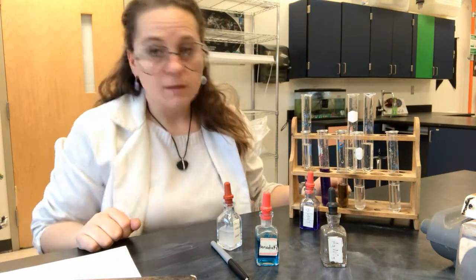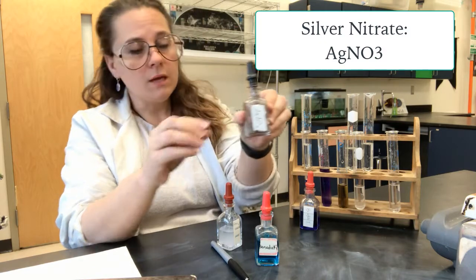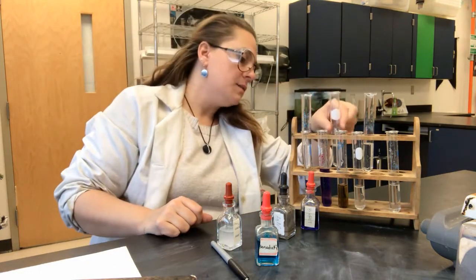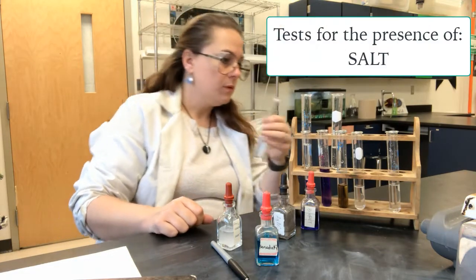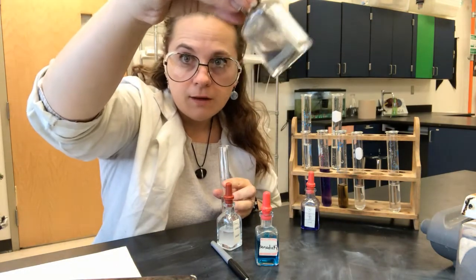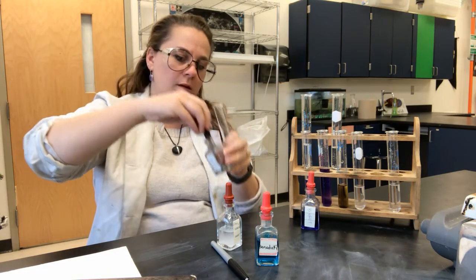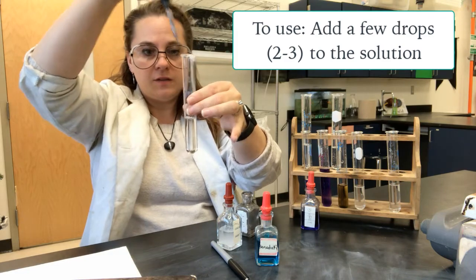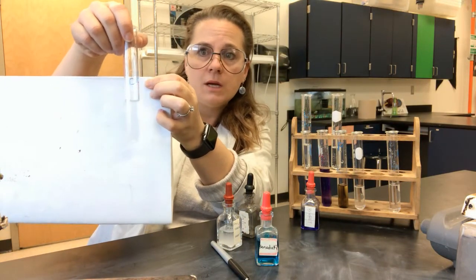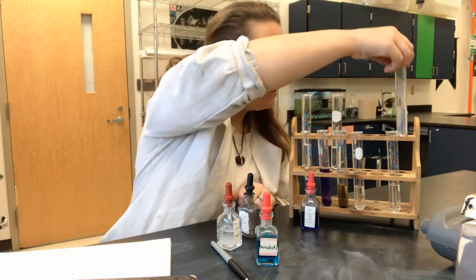The next one is an indicator for salt. You can use a substance called silver nitrate — AgNO3. Silver nitrate is a great indicator for salt because it forms a very interesting white precipitate when salt is present. The indicator itself has a silvery, shimmery appearance. For the negative test, I'll add just a very little bit — when it mixes in I can see it still looks very clear with no sign of a precipitate forming. A precipitate means a solid is going to form due to a chemical reaction with the salt.